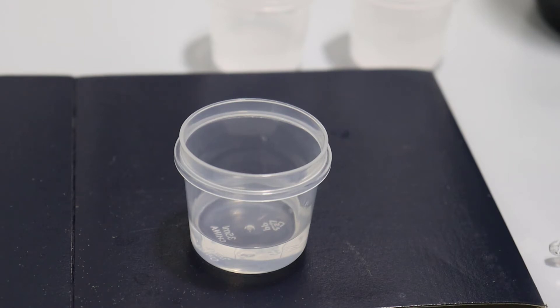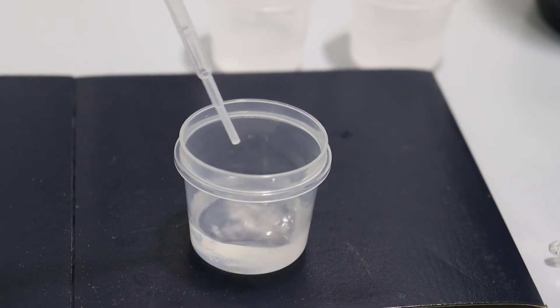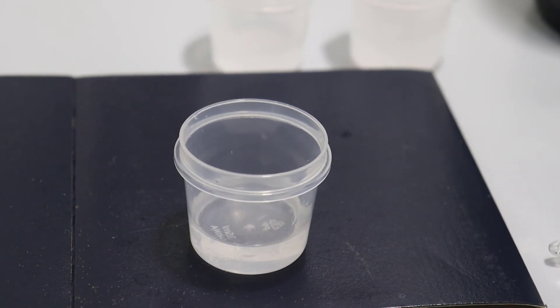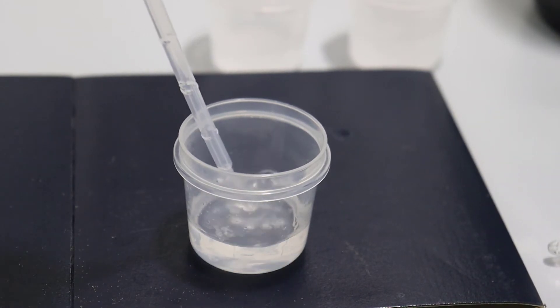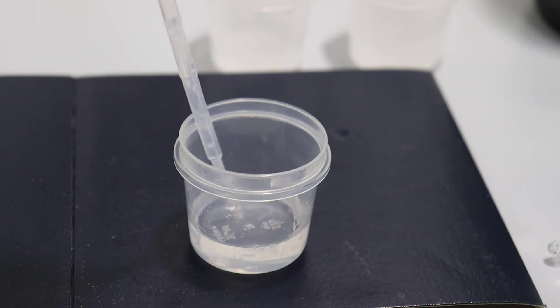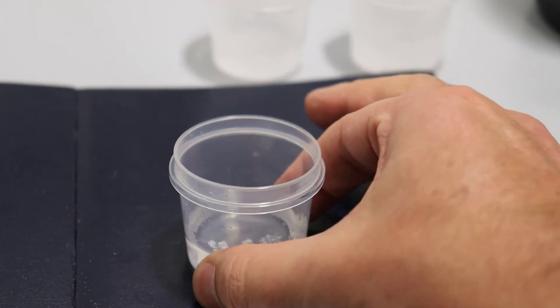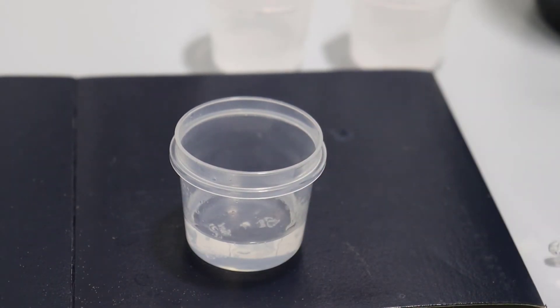We get back the oxygens. Now what it needs to do is hydrolyze for a little while. First of all it's mixing — you can see it's gone white. That's because the silane doesn't mix very well with water. The reaction has however proceeded a little bit, otherwise it wouldn't mix at all. Typically this doesn't mix in the slightest, so it's already reacted to form the silanol, which is more hydrophilic than the starting compound.